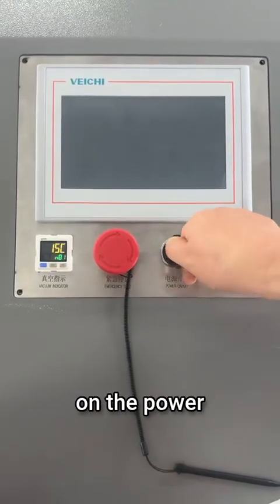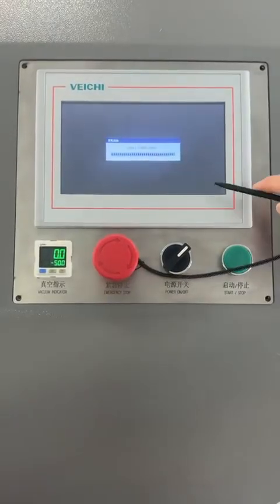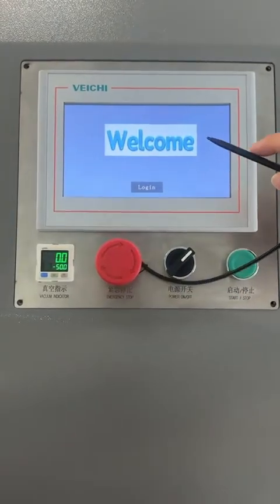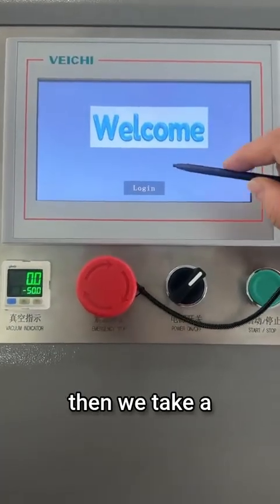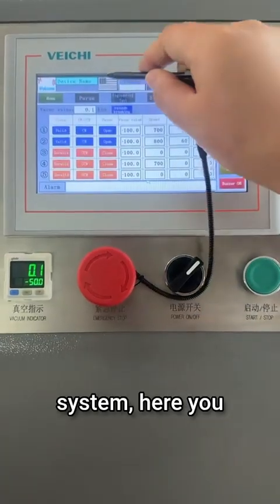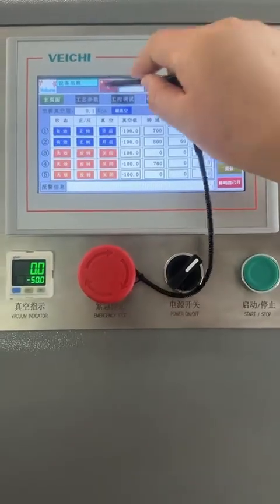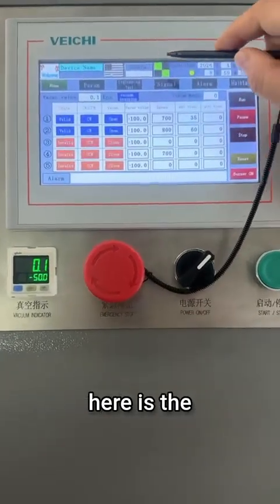First, we turn on the power switch and then the screen will light up. The screen lights up and then we take a look. Here is the welcome screen. Click enter system. Here you can select the language, Chinese or English. We first select English, then here is the login password.